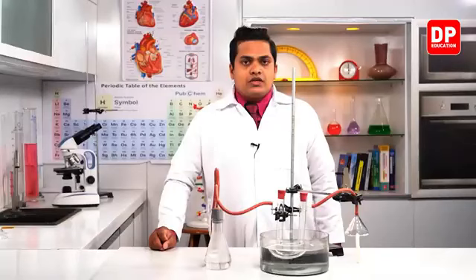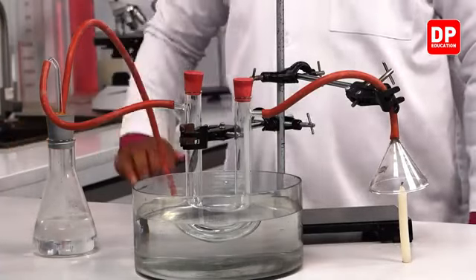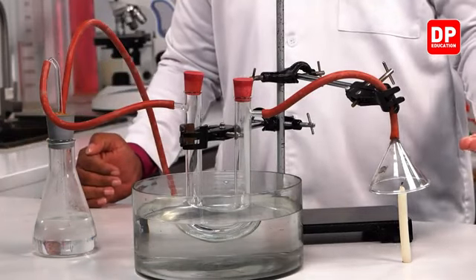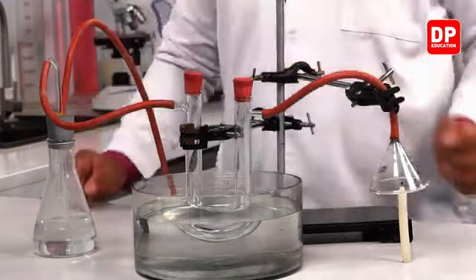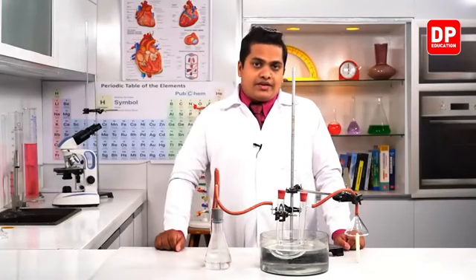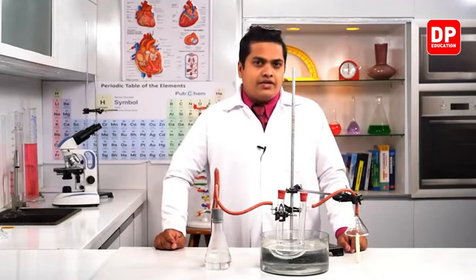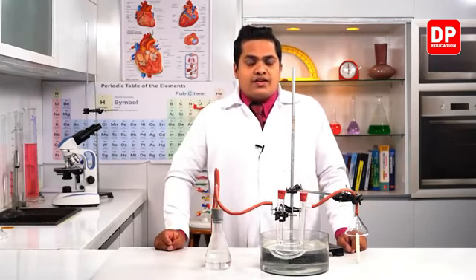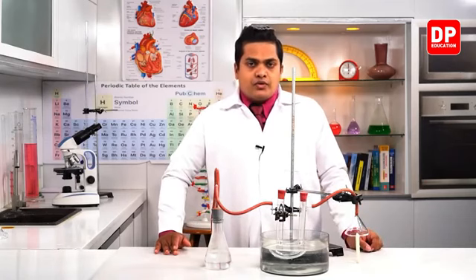When the aspirator is working, the gas inside the system is sucked out, so the products created by the candle flow only towards the U tube and the other parts. Otherwise the flame will go here and there and the products will not flow towards these materials, so getting observations would be quite difficult. The aspirator gives enough time to get a good observation from the experiment.